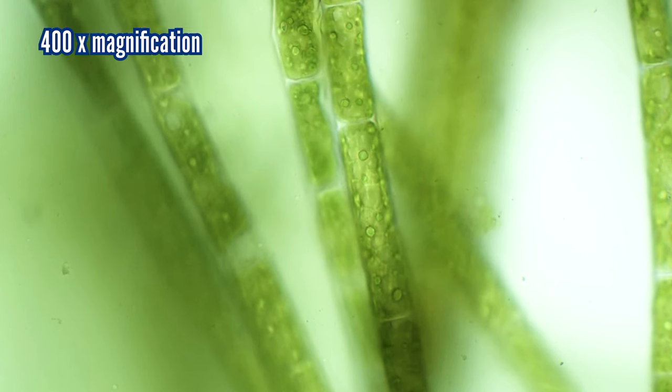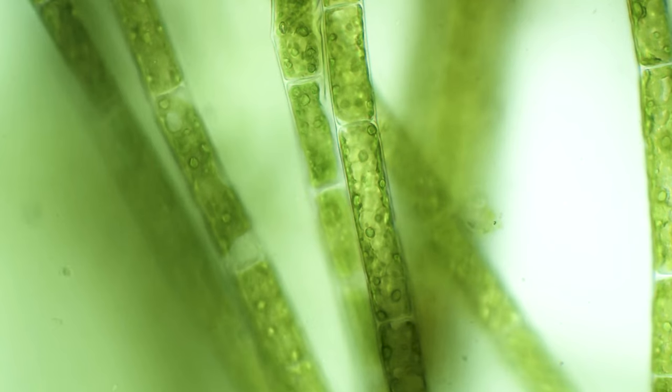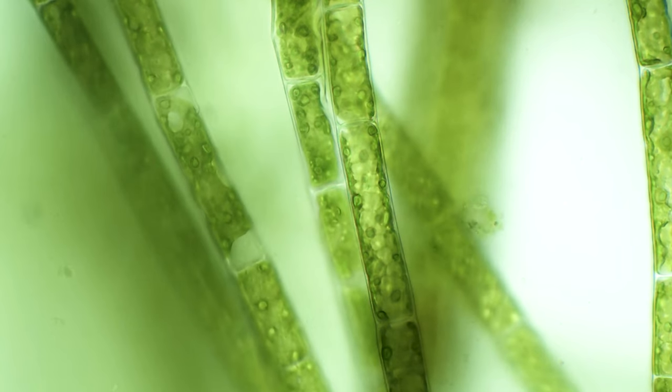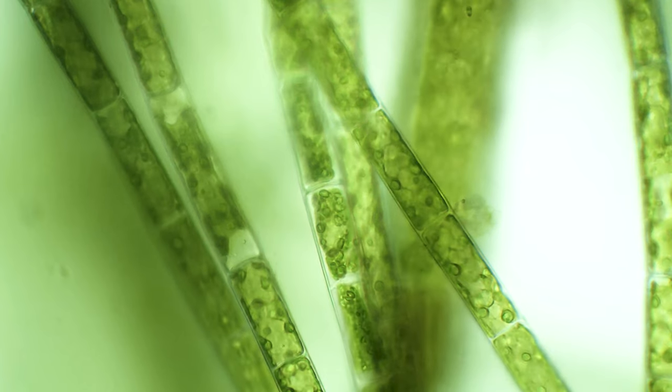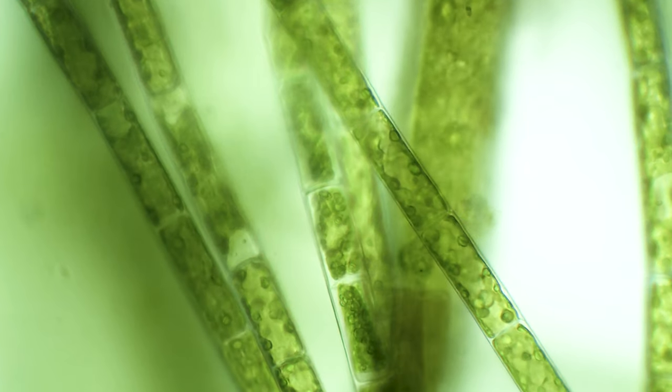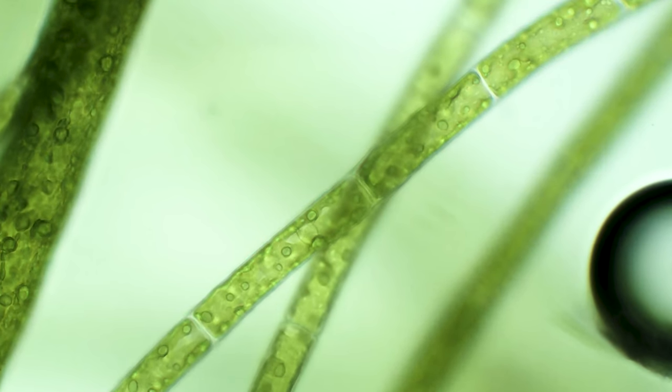Pretty cool, right? So in order to do some kind of build-up, I'm going to present the most non-moving stuff first. Let's start with the more primitive and also a lot more prevalent specimen from our plant collection: the algae. We can see that it consists of quite thin strands, and if we look closer we can see that they actually consist of single cells placed next to each other.